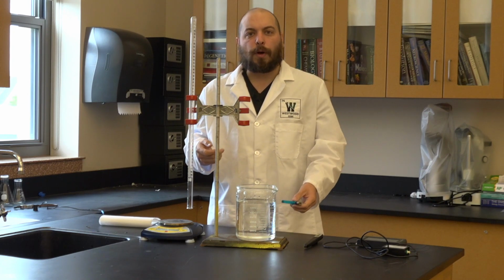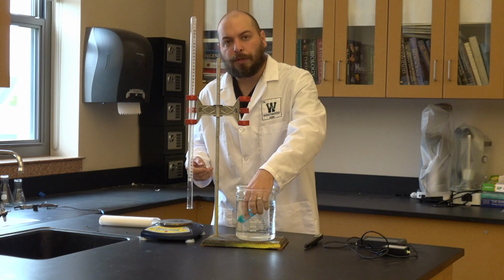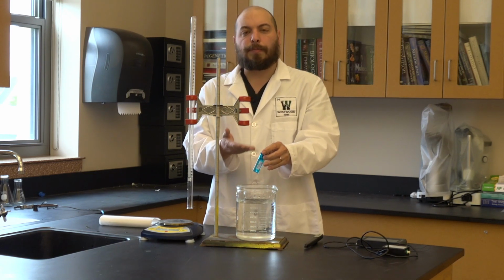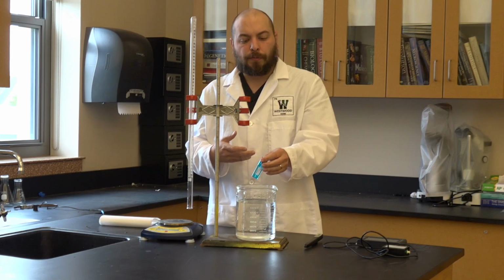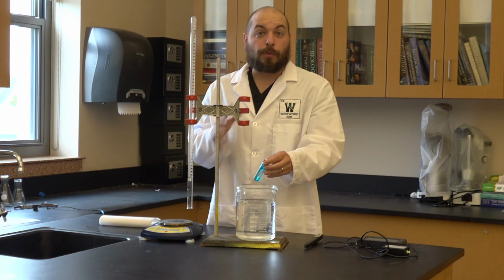Because the lighter is going to end up in the water, what we're going to do first is dip the butane lighter in the water. We're going to hold it there for a couple seconds, kind of roll it around. What that's going to do is get the butane lighter wet. When it's wet, it adds a little bit of mass. The problem is if we measured it dry now and then wet later, we'd have a source of error. So we don't want that.